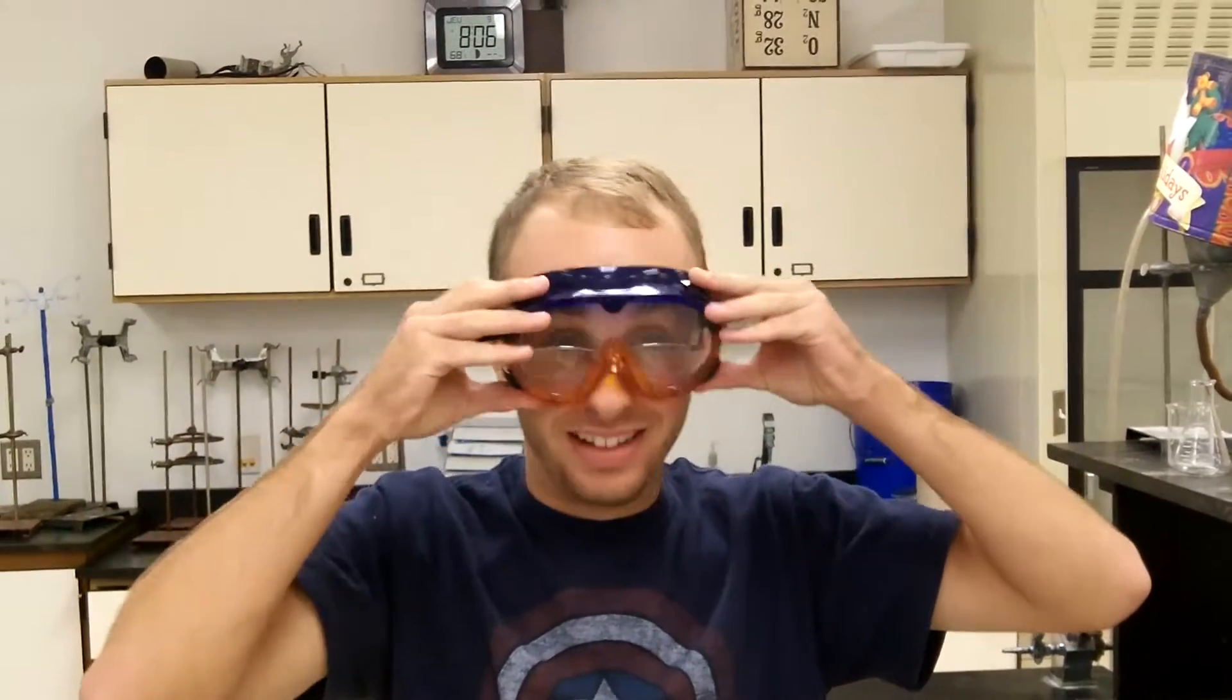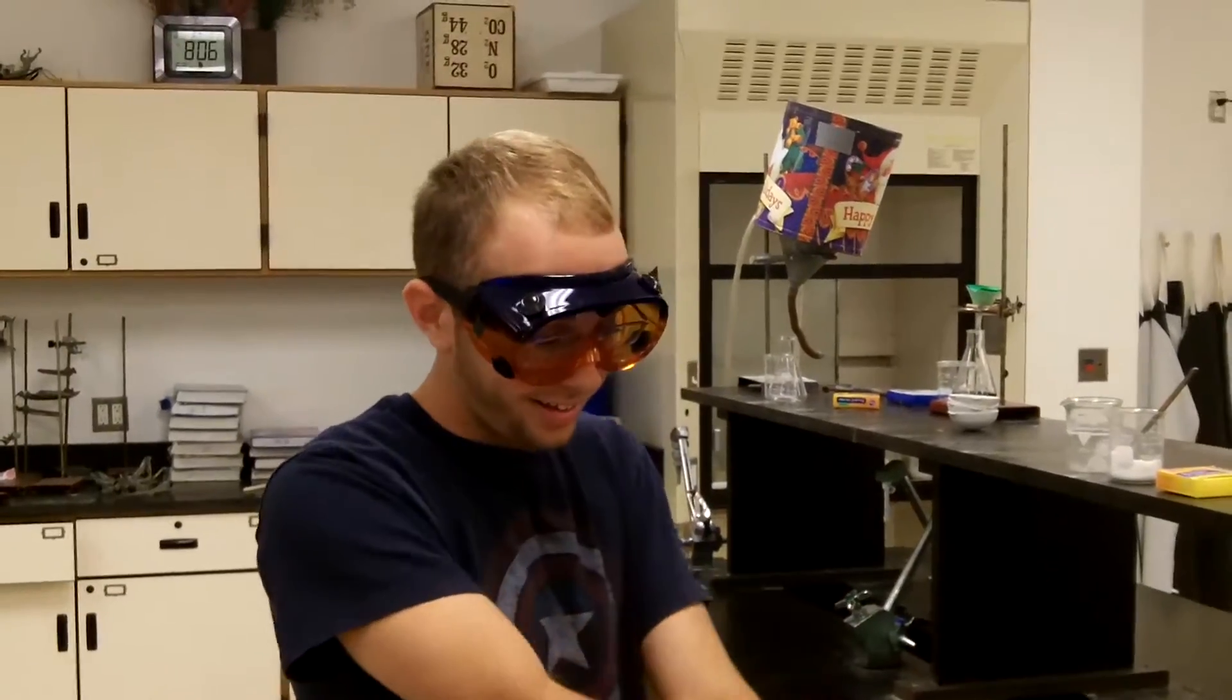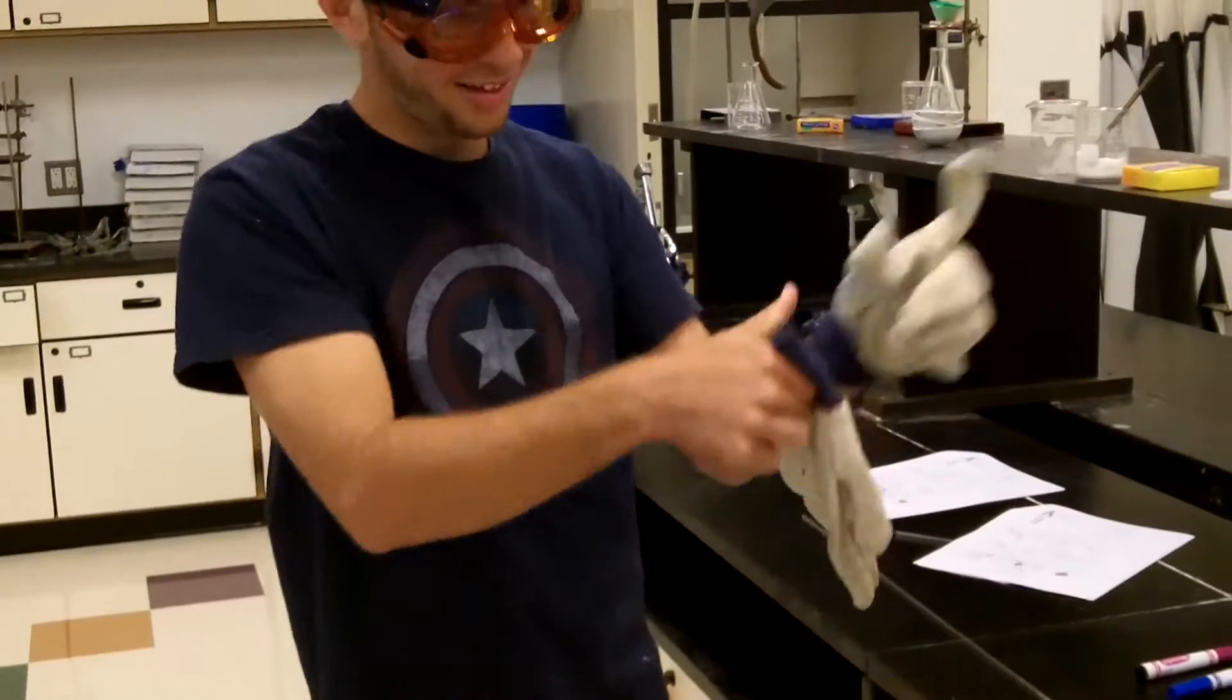Make sure you always wear safety goggles in the lab at all times. If the glasses break, get a new pair. If desired, wear gloves in the lab to reduce the chance of injury.